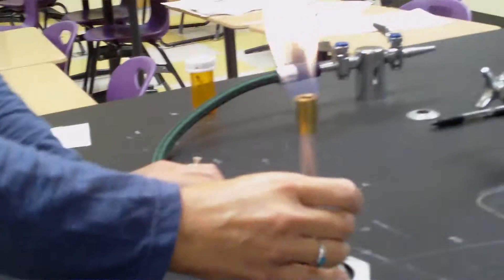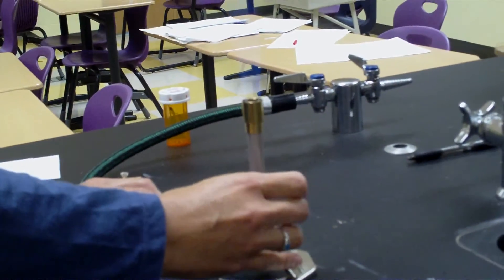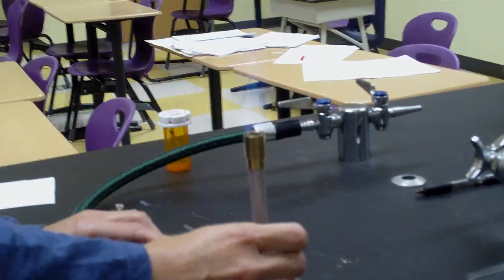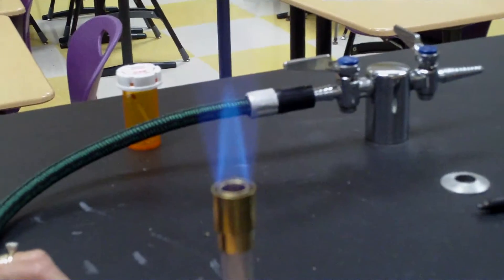I'm going to open the air vents back up. And we want to see the blue cone inside of the other blue flame.